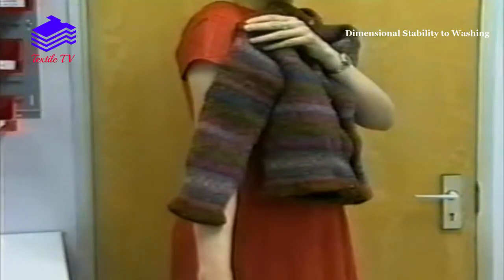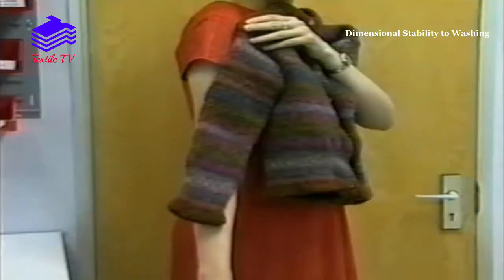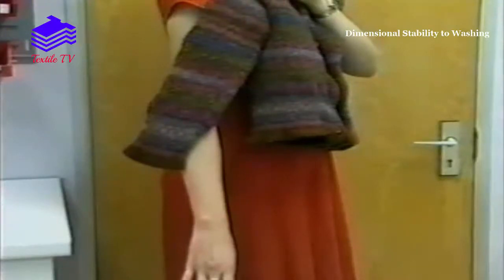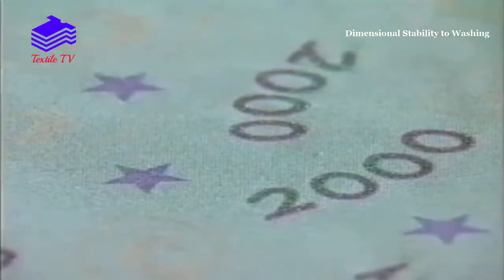The fabric can shrink or stretch due to washing, which will cause the made-up garment to become misshapen and not fit the size intended. The stability of a garment is affected by the ability of a fabric to withstand the washing and drying processes when washed in accordance with the appropriate care label. Different fibres, fabric construction and finishing treatments of the fabric and/or garment will have a bearing on its dimensional stability.